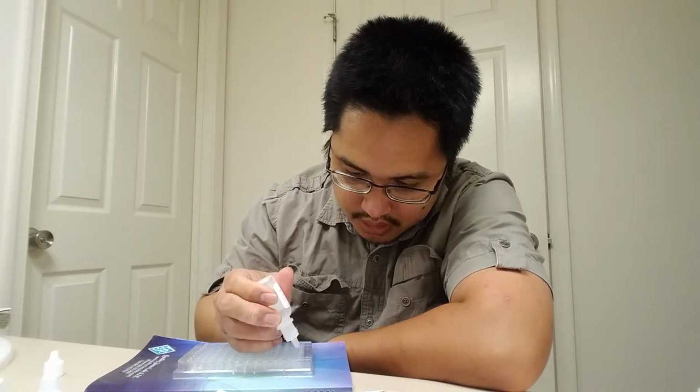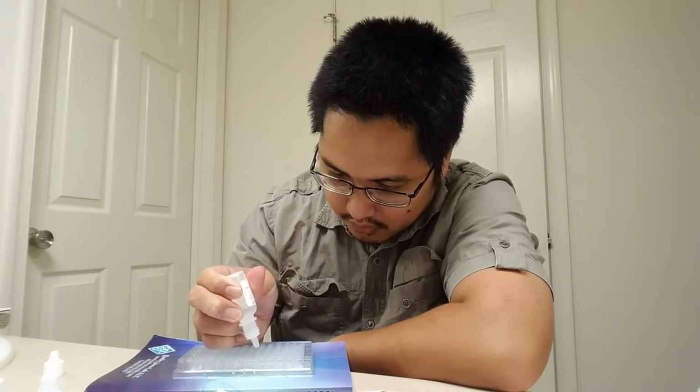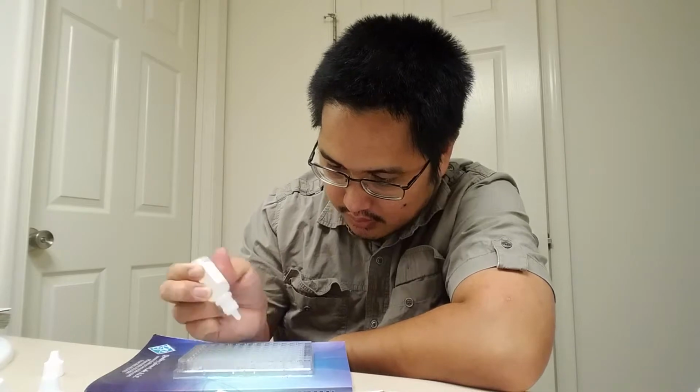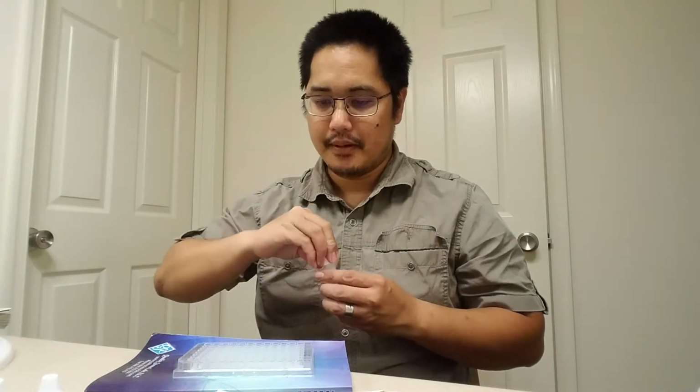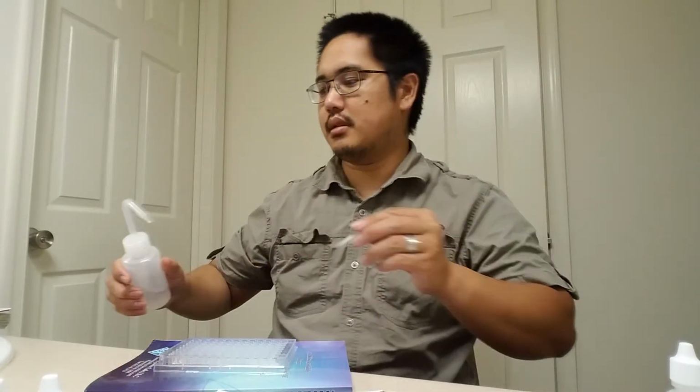So I'm just going to put 1 drop in each. 1, 2, 3, 4, 5, 6, 7. There we go. All right. And I'm going to stir it. I can even use the toothpick a little bit. I'm going to douse this with some deionized, but distilled water. Stir it, douse it, stir it, douse it. And from this, I can observe whether a reaction took place.